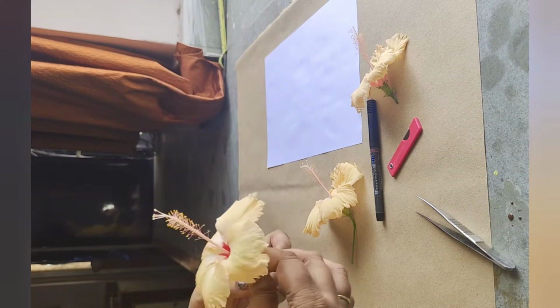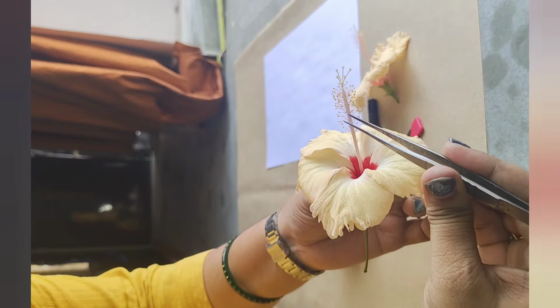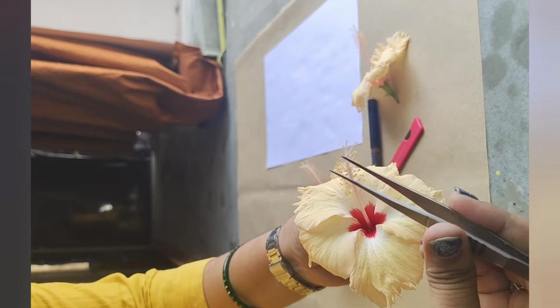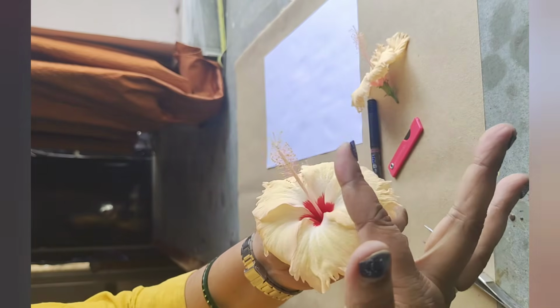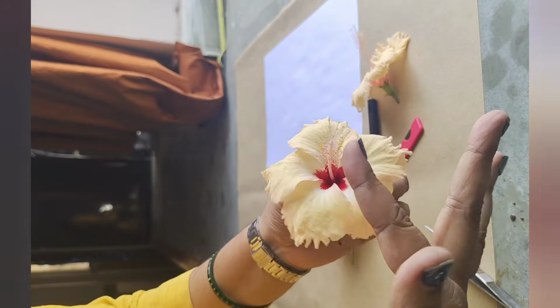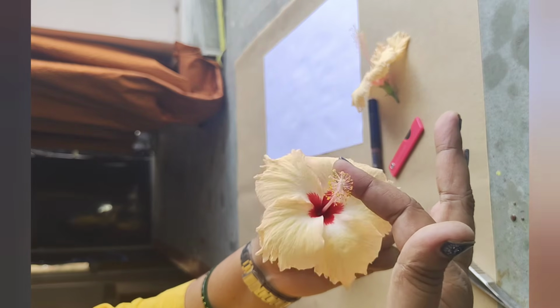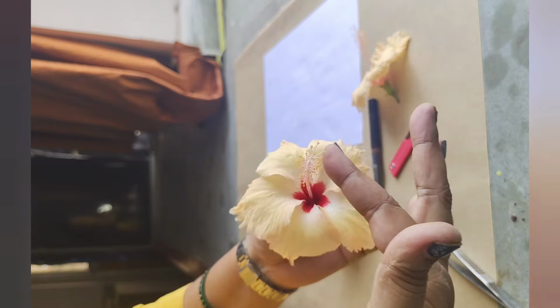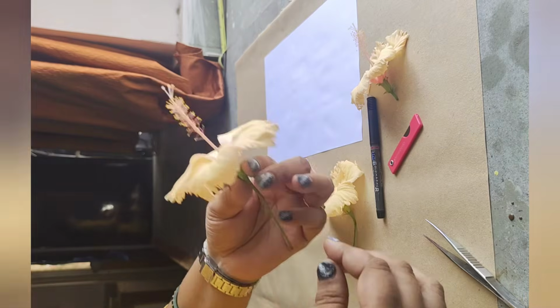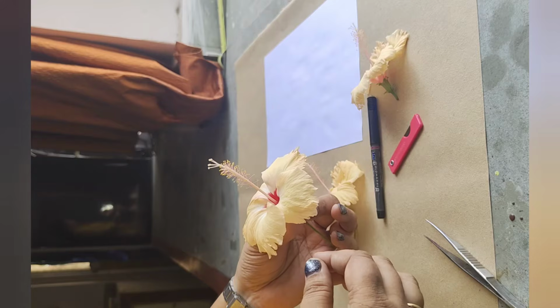Then, in the middle of the flower, we see the staminal tube, which is formed by the fusing of the stamens, and in between the staminal tube is present the gynoecium of the flower. Also, if we touch these anthers with our bare hand, some pollen may be deposited on our fingers, which can be seen microscopically. So, let us start the dissection of this flower to see all the parts of the flower.